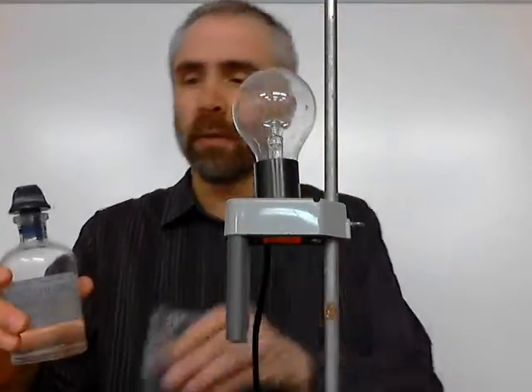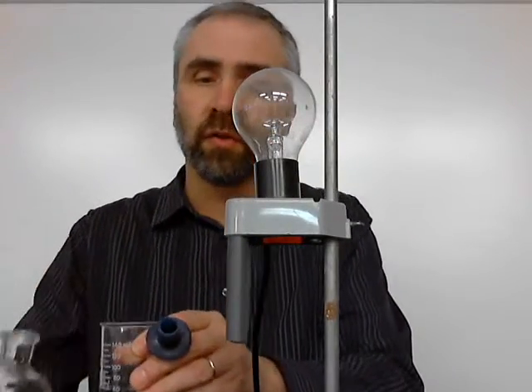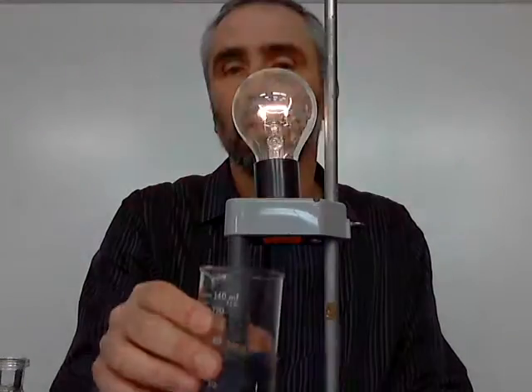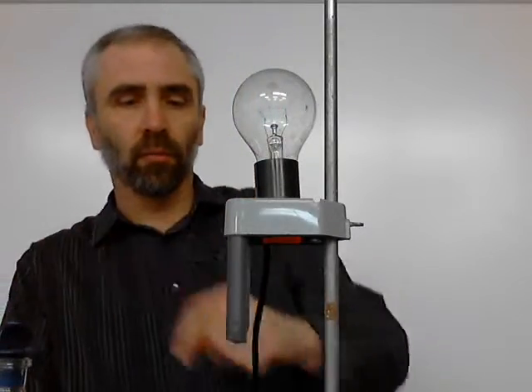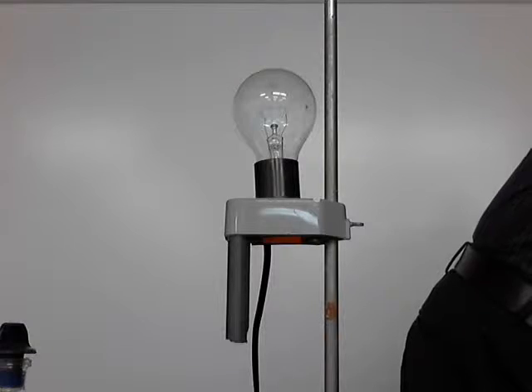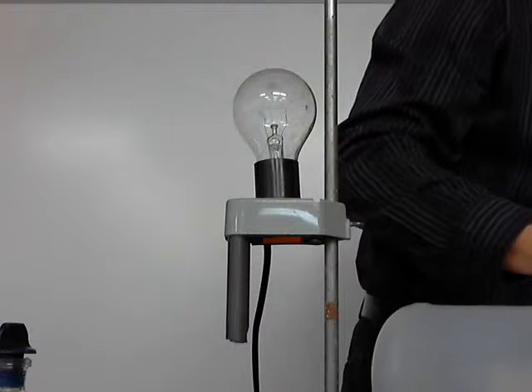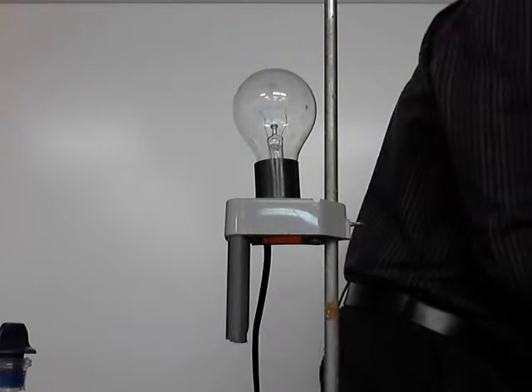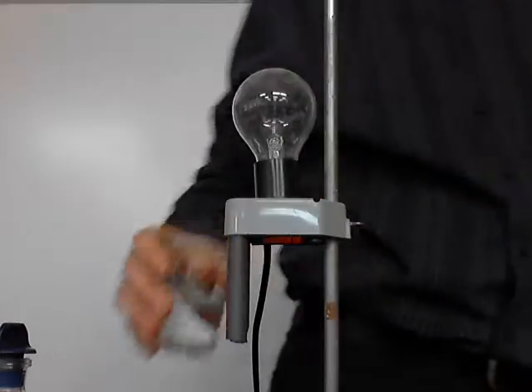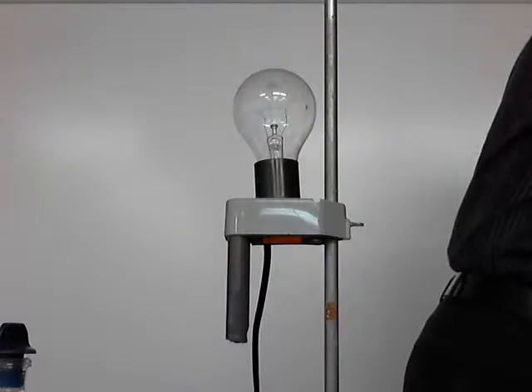So when I put some hydrochloric acid, which is going to be my first example on my notes, we see that this guy gives me a very bright light bulb, right? And I'm going to wash that off so it doesn't ruin the light bulb. But you saw how bright that was. Whereas, and I'm going to test this one now so I can move it out of the way, I better wash that off first, because watch, just the amount of acid left on those wires still lights the light bulb a little bit. Just wash that off first.